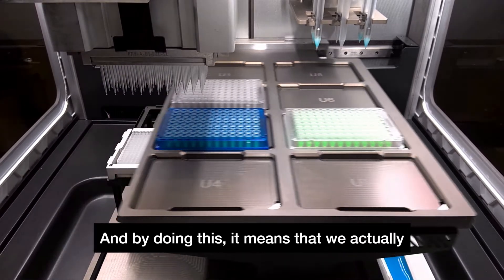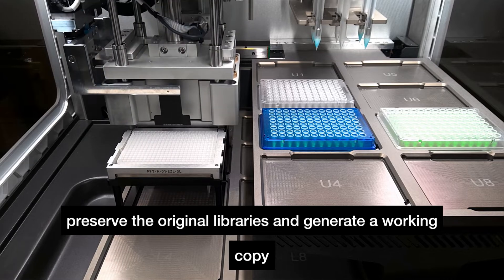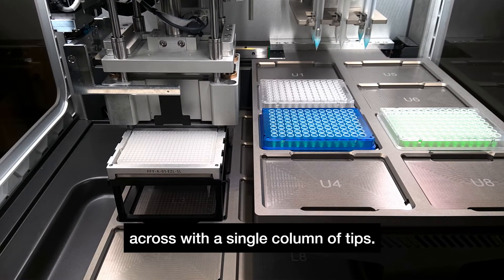By doing this we preserve the original libraries and generate a working copy in the blue plate that we can then work across with a single column of tips.